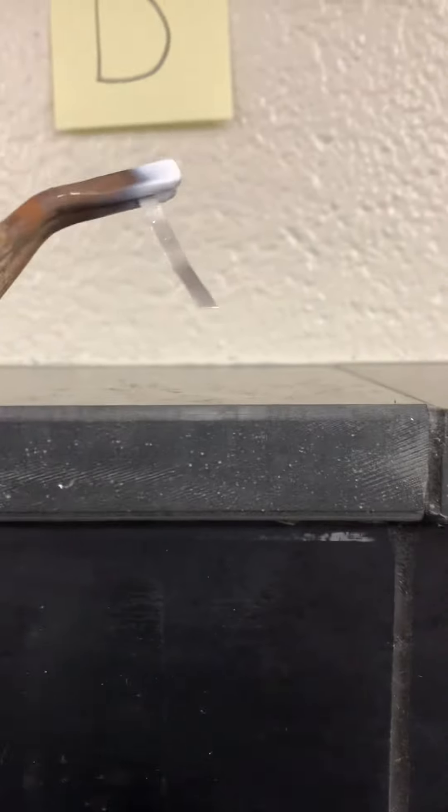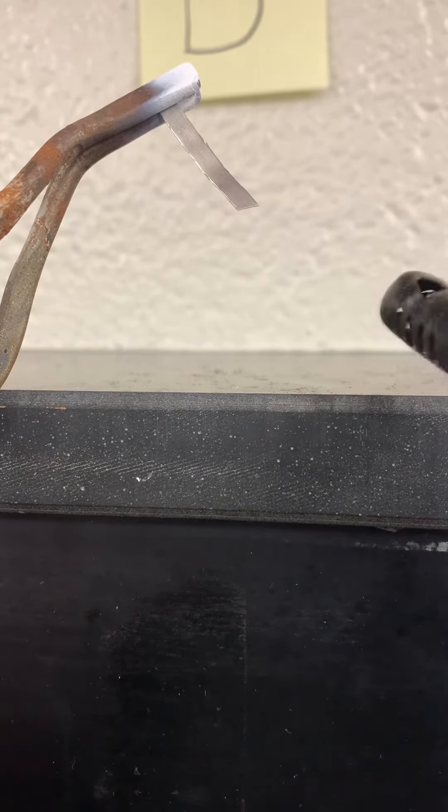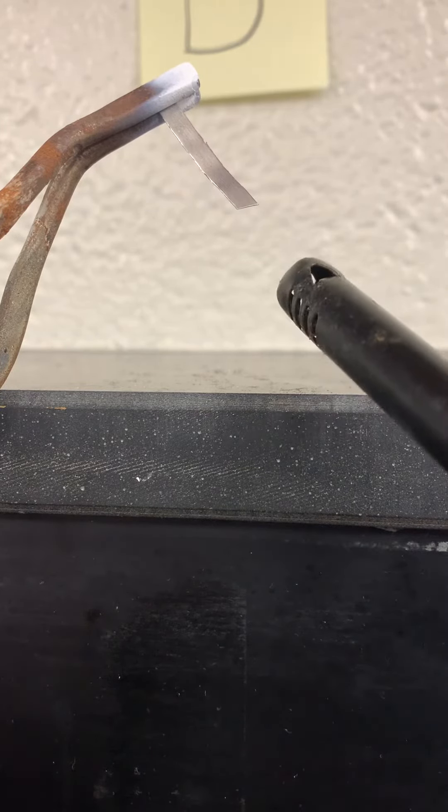I'm gonna hold on to it with some tongs here and I'm gonna attempt to light it and we're gonna see what happens.